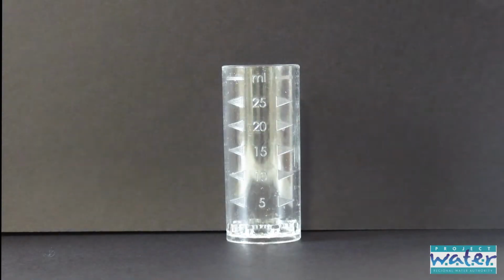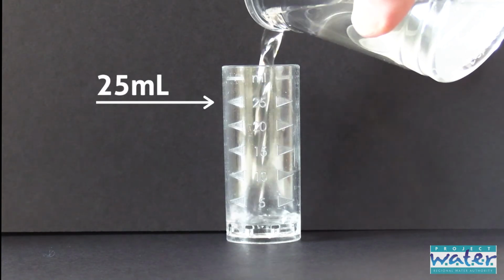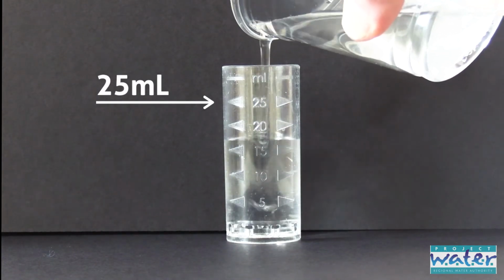You're also going to need a chemical to get the test results. That's going to be in this sealed glass tube. It's called an ampule, and they come in this box. Your teacher's going to pass these out to you when you're at that step of the directions. Take out the plastic test tube and fill it with water to the 25 milliliter line.